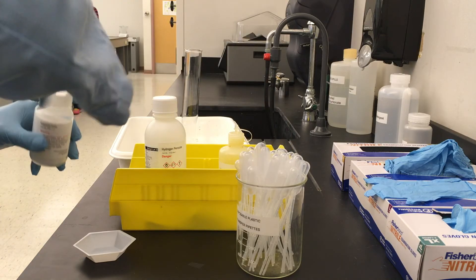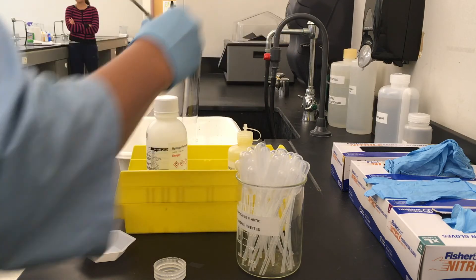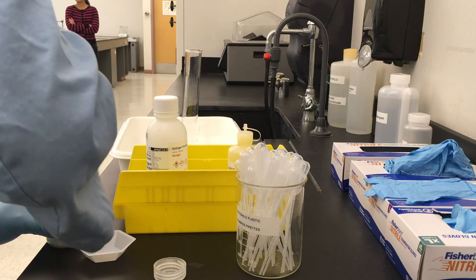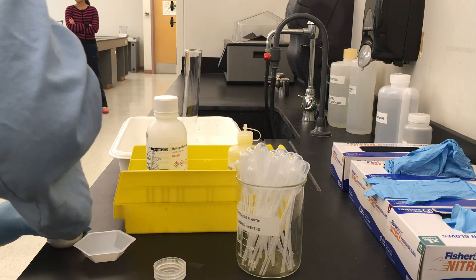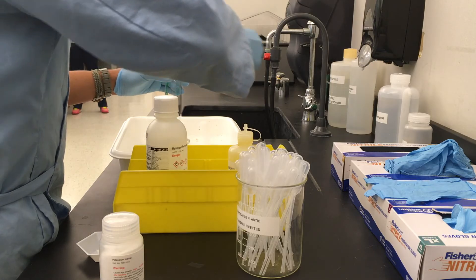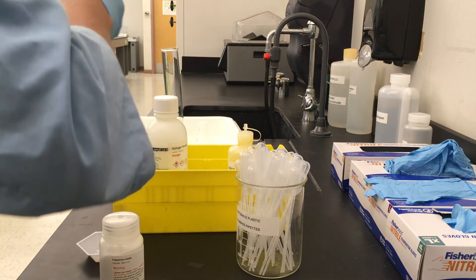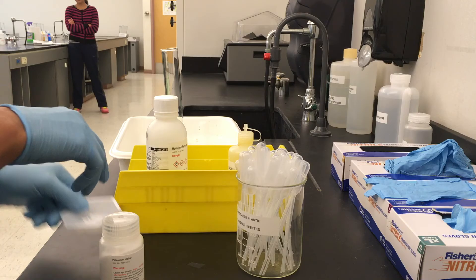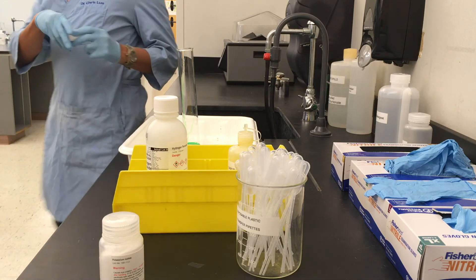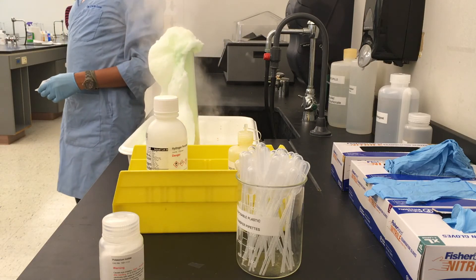Next, I am going to add some dish detergent and some food coloring to the graduated cylinder. The purpose of the dish detergent is so that you can more easily see the bubbles, or the oxygen gas being produced in the reaction. The food coloring just gives a nice colored effect. I like to call this reaction elephant toothpaste — because it will foam up, as you will see, like a tube of Aquafresh toothpaste.